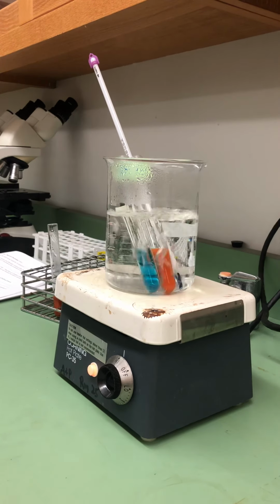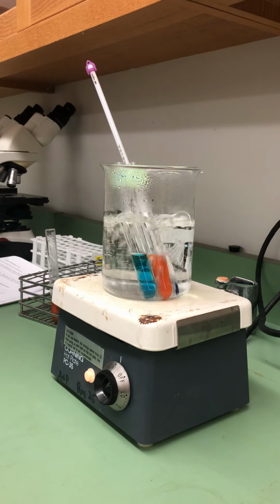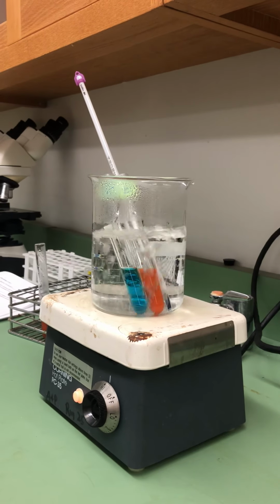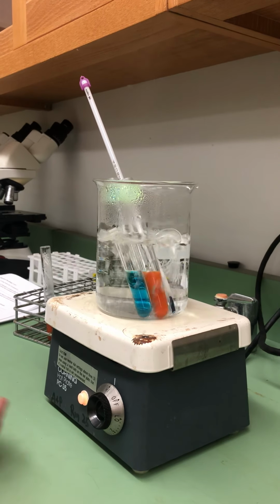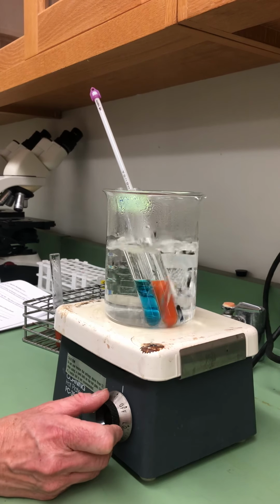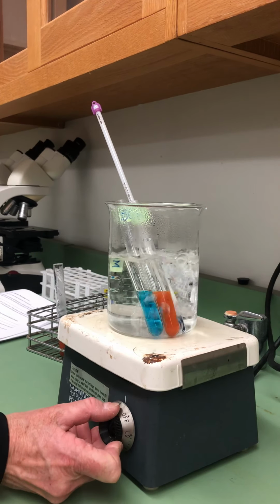I'm going to verify that the color change is not different by looking at the top and the sides. And since I didn't see a deepening of color, this is probably as much maltose that's present at this time from the reaction using the enzyme. We had a higher concentration of maltose, we can presume, in the standard based on our current observation. This is typical, this color change, of being less dramatic as the red we saw in the standard. This is typical of what we've seen in the past.